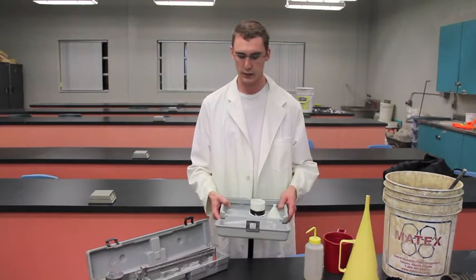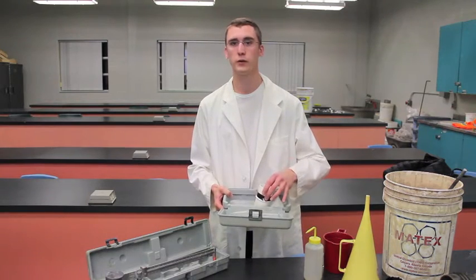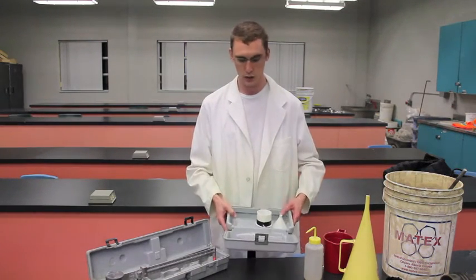Our other test is going to be the sand content test and right here we have our sand content kit. It comes with the sand content tube and the funnel, and this will tell us how much sand is in our drilling mud.